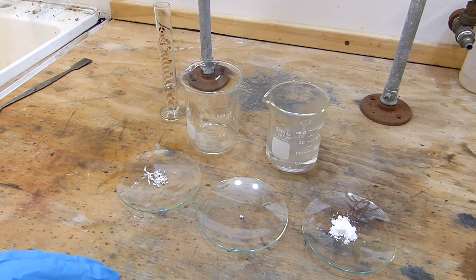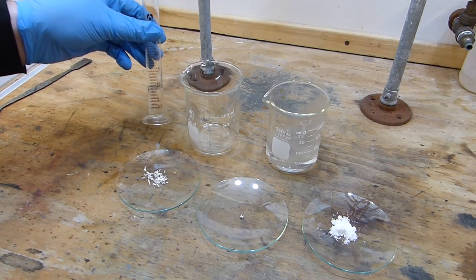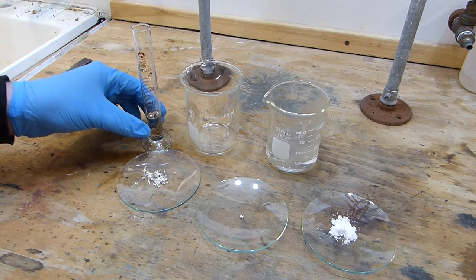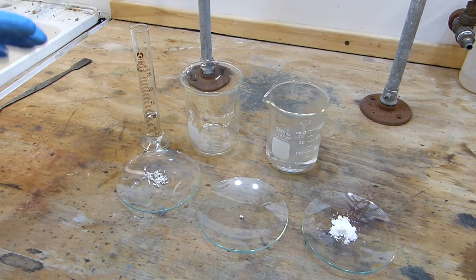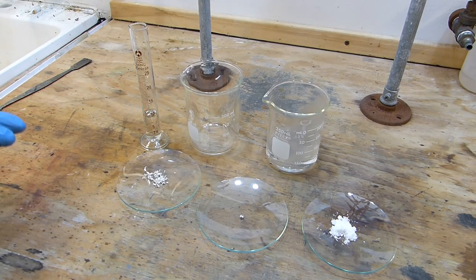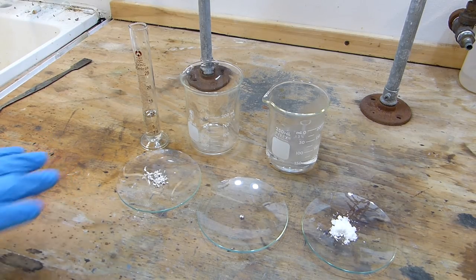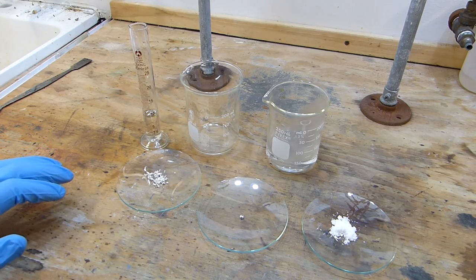It's going into this beaker of hot water to dissolve for now. The mercury and silver are going to get added to this beaker where upon just under 10 milliliters of concentrated nitric acid are going to be added. Actually this is azeotropic nitric acid at 68 percent and really only two milliliters is actually needed, but the 10 will give it a lot of extra strength, keep it concentrated, and make this reaction go a whole lot faster.